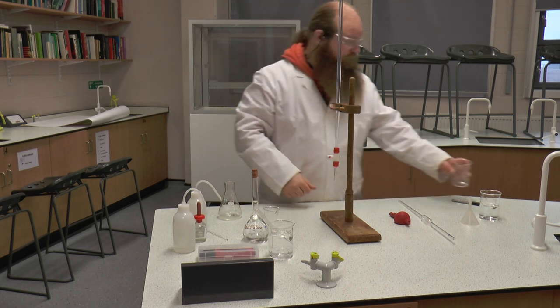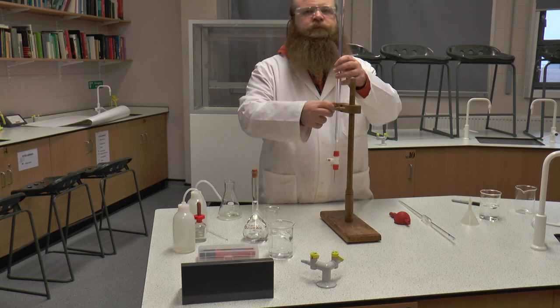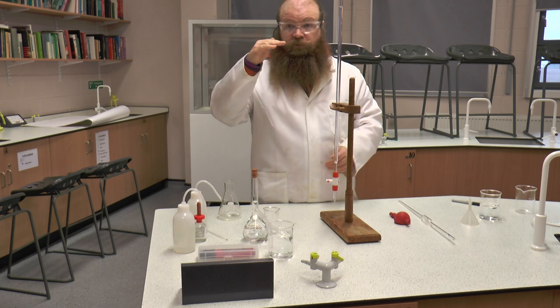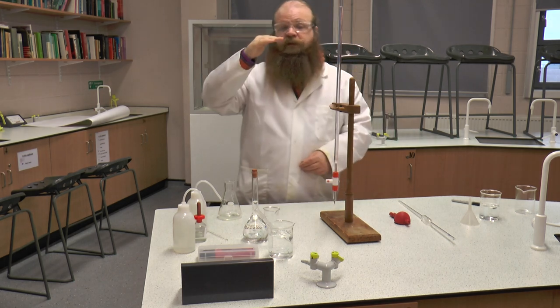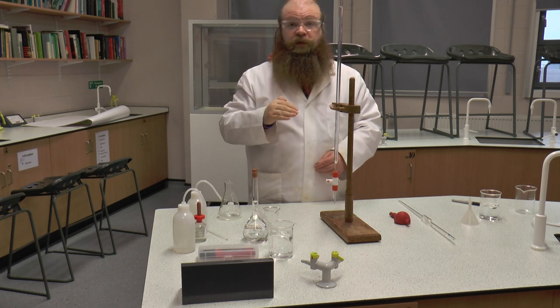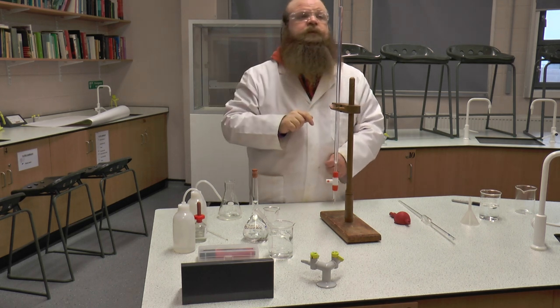That has left me with a starting titer, which has to be read at eye level. If the line is above or below eye level, you will not get a true line on the meniscus. The meniscus needs to be in line of sight with your eye. The meniscus is the little curved bubble at the top of our solution.